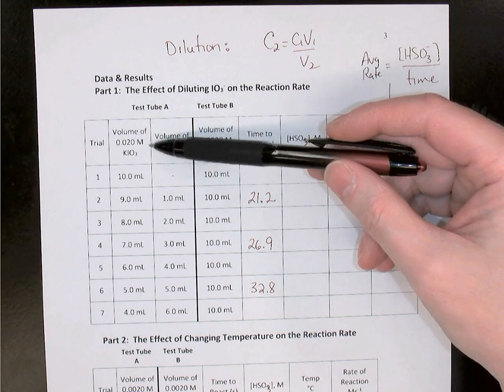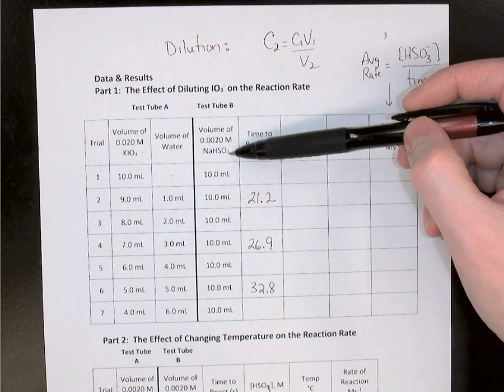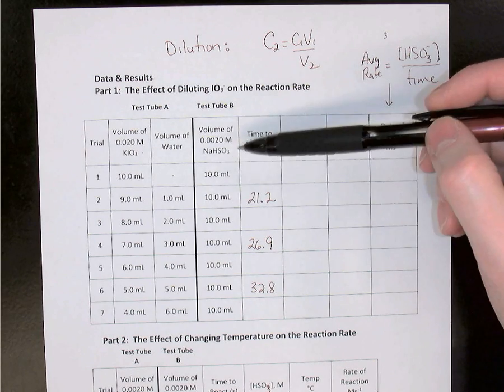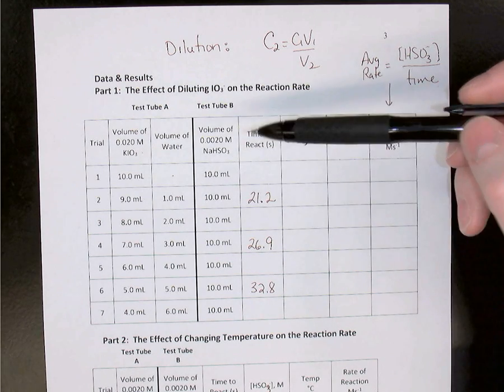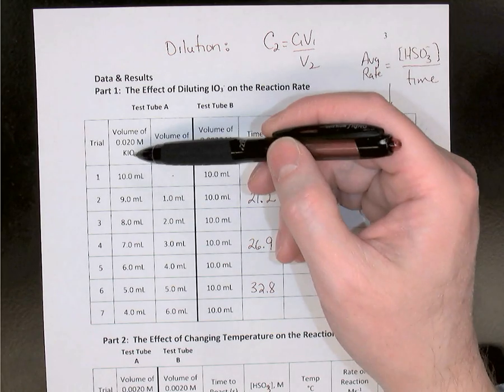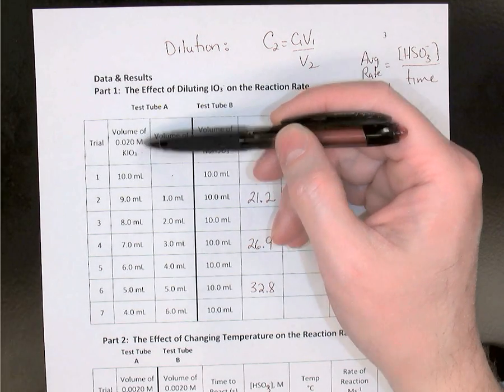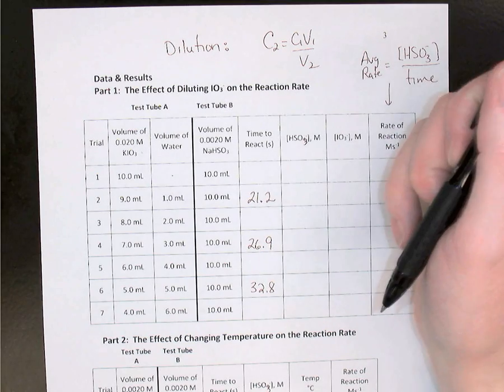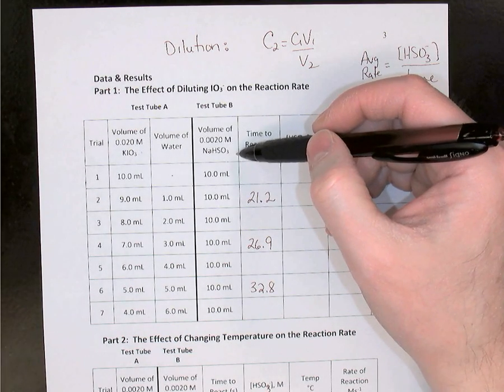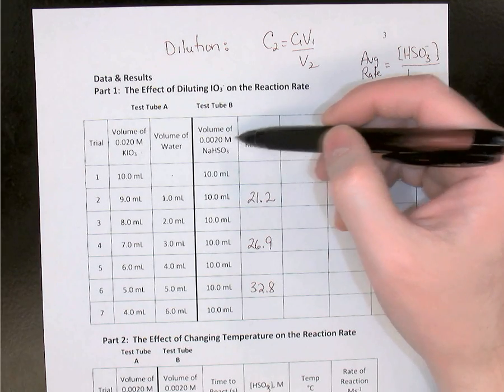We were mixing solutions of potassium iodate with sodium bisulfite, and we were timing how long it took for a blue color to appear. This is the iodine clock reaction. The KIO3, potassium iodate, was labeled on the bottle as 0.020 molarity.